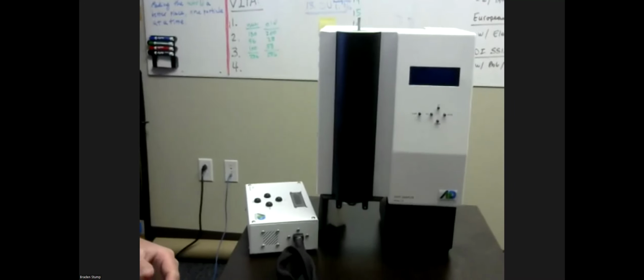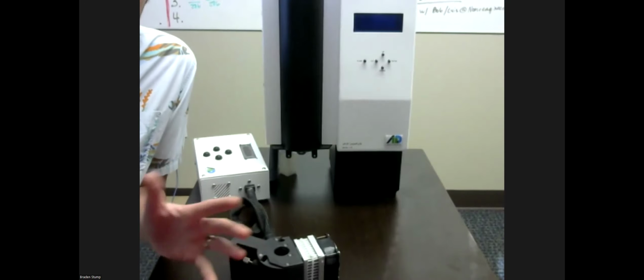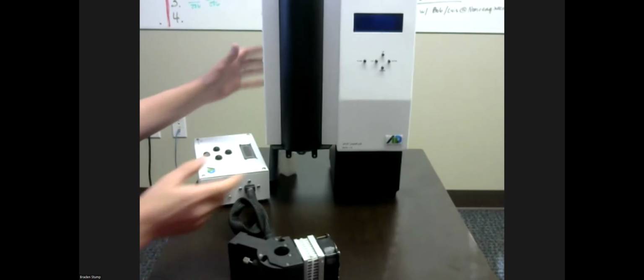With that, let's start getting to the fun stuff here. And I have a spot sampler here and a TLC unit that I'll be able to show you how things come together. Just because this is more of a tech overview and less of a direct training, I'm going to take things a little bit faster than usual.